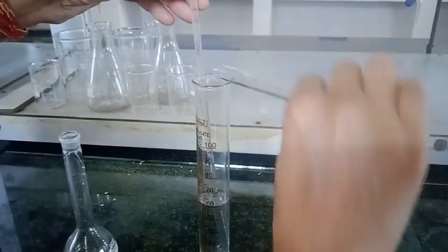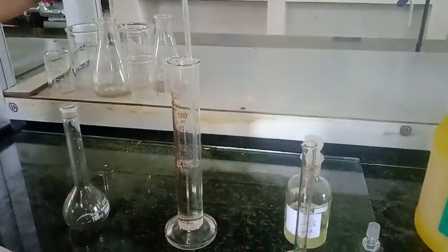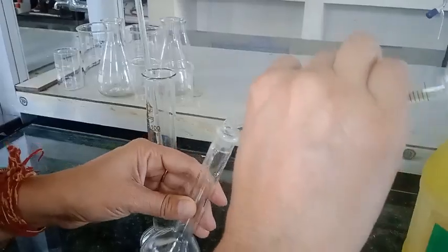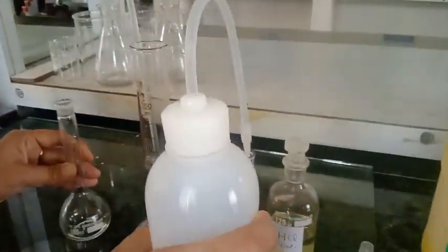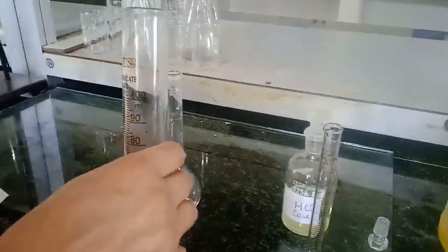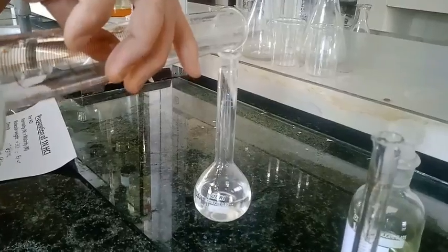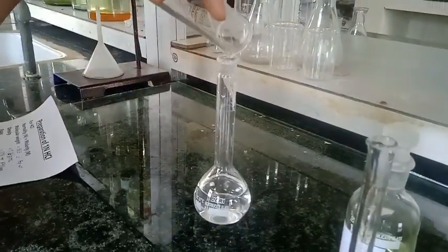Why I use this measuring cylinder, because sometimes if I add it directly there is chances of bumping. I shake it properly so that it mixes homogeneously and now I will rinse this measuring cylinder from which I have transferred this HCl solution.